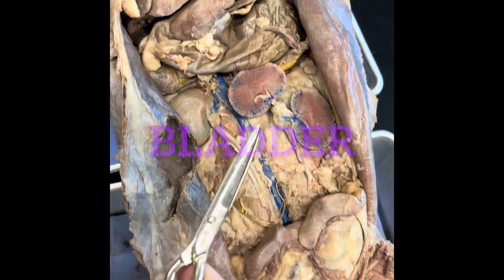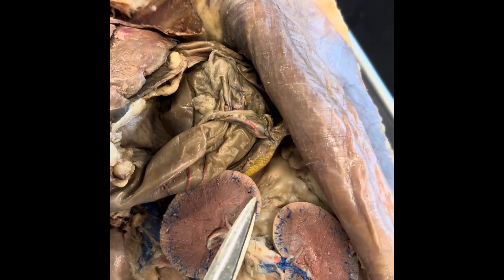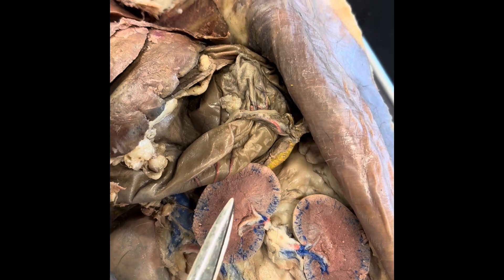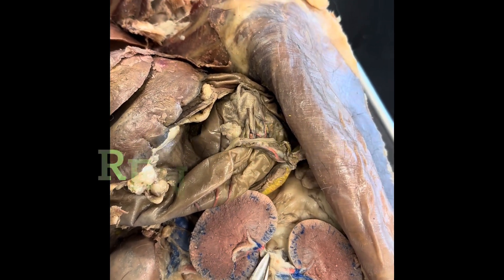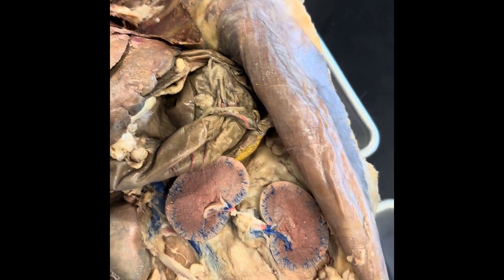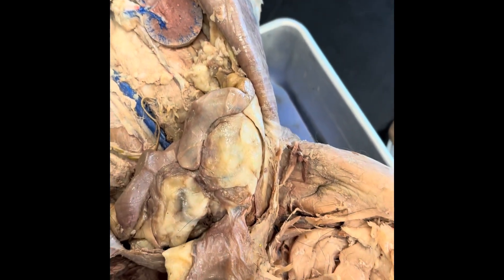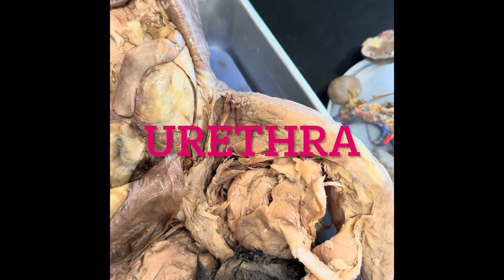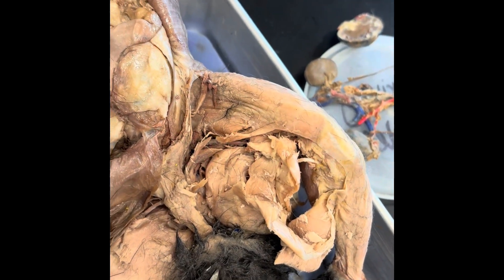Here is the other kidney and we went ahead and opened it up. Here we have the lighter colored cortex. In the middle is the medulla, and that drains to the renal pelvis and then out the ureter, and the urine drains again to the bladder. The urethra would then be in this area from the bladder to the outside of the animal.